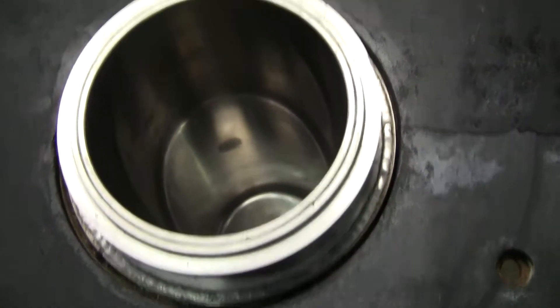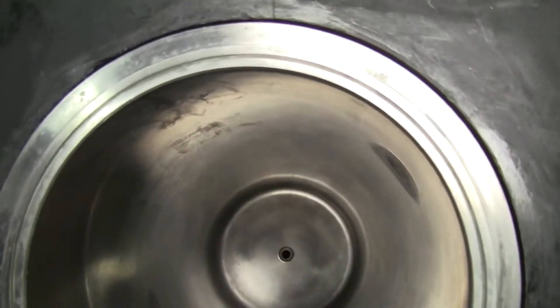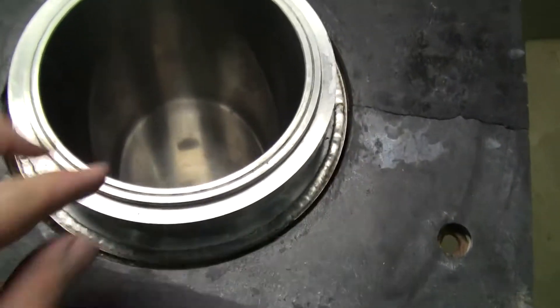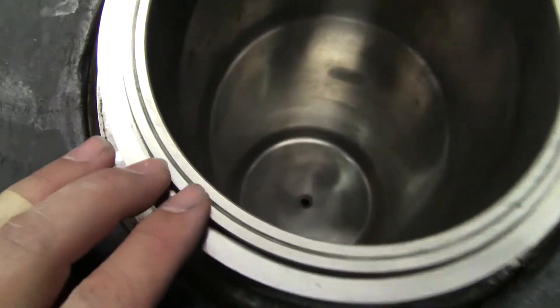See if I can push a little bit more light in there. Oh yeah, that's nice. I can really see it. It looks like it's in perfect condition around here, around the side.